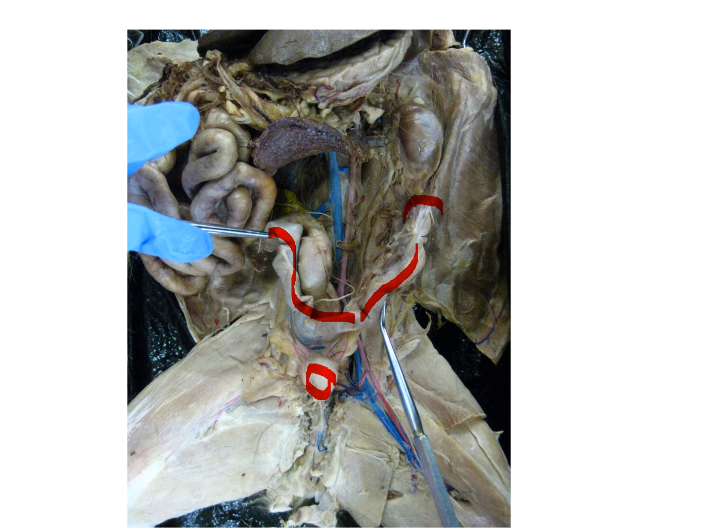Out here that I'm circling is an ovary. If this cat had not been euthanized, all those pouches that you're seeing in her uterine horns are basically kittens. They can get pregnant in each uterine horn and have a lot of kittens, obviously.